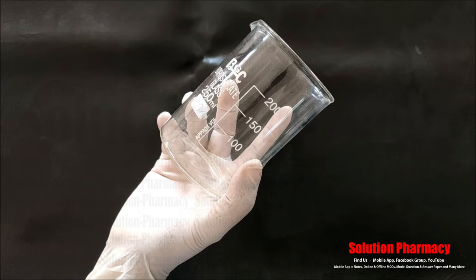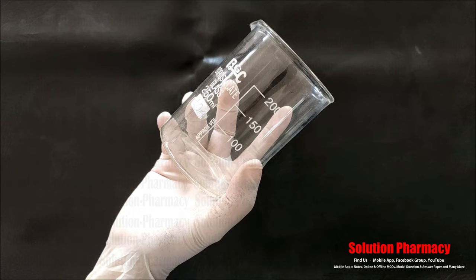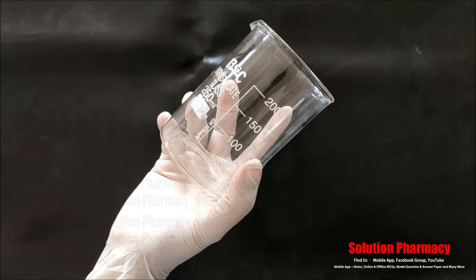The first glassware you can see here is called a beaker. A beaker is a simple glass container in which we keep some liquid, samples, and reagents. We can mix, stir, and heat solutions in this beaker.